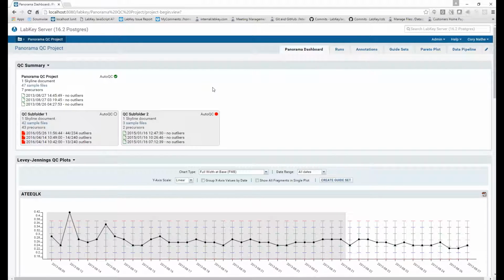Finally, the third improvement for this QC summary web part is to show more details about quick statistics for the most recent sample files uploaded into a given container. So you'll see in my information about my current container, I have one Skyline document imported which has 47 sample files in it. From those 47 sample files, the 3 most recent sample files are displayed here based on their acquired times, along with indicators of how many outliers they contain within the given container's metrics.